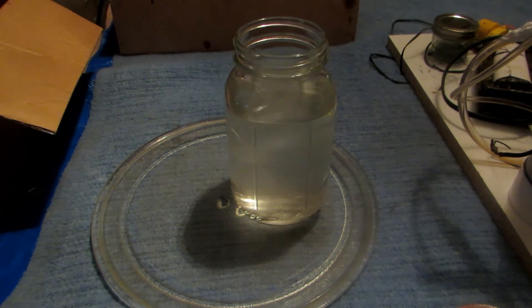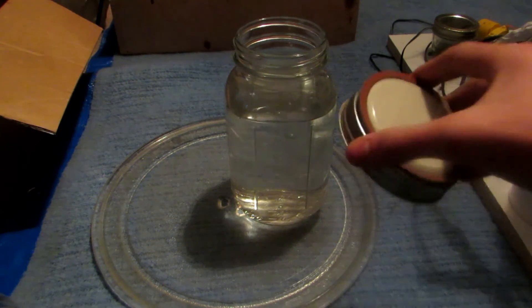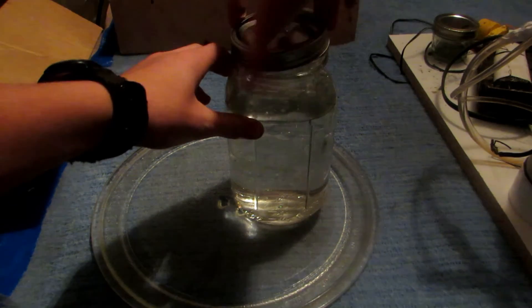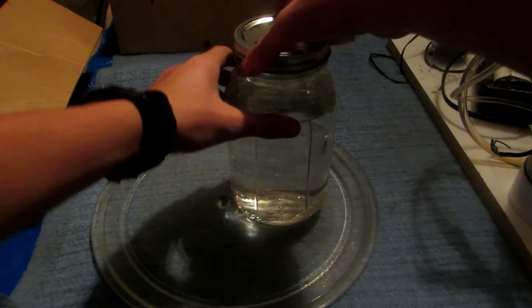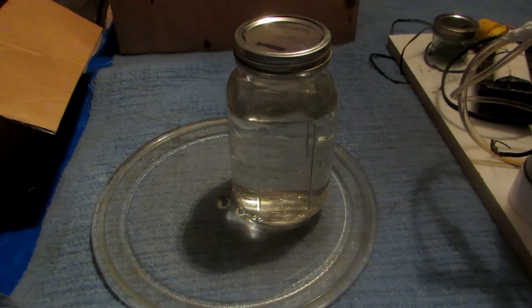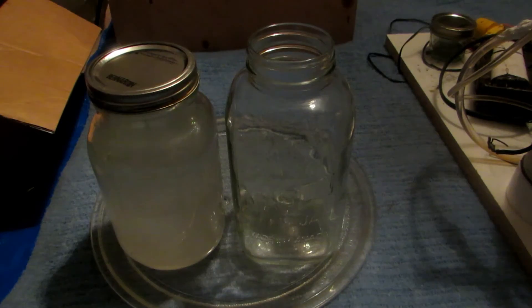We now have about 1200 milliliters of liquid, and they have separated into layers — very cool. We're going to lightly shake this around to get the dichloromethane to mix with the water so any methanol present will go into the water layer. We can then separate out the water layer, repeat the steps a couple of times, and we should be left with fairly methanol-free dichloromethane.